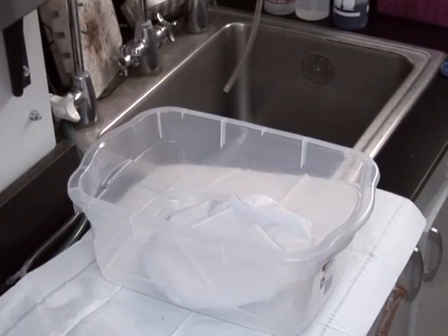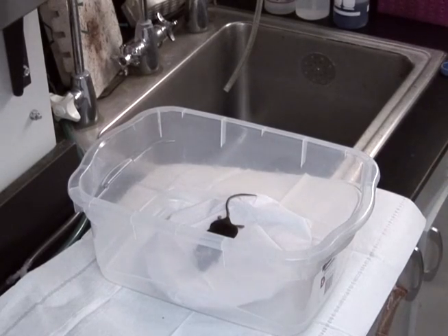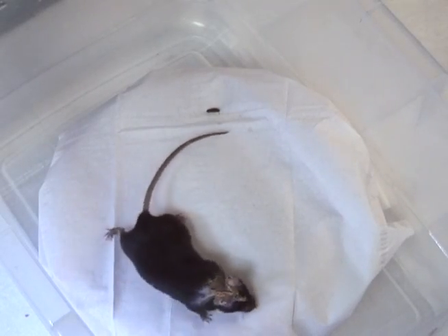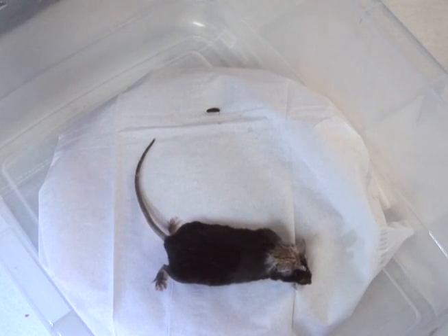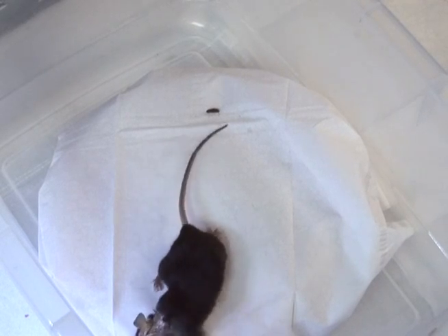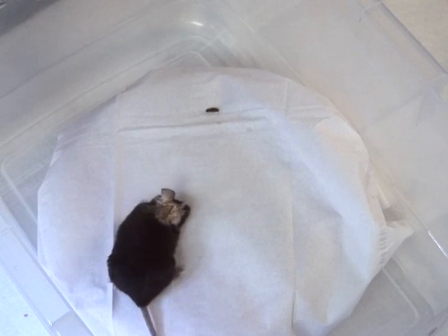After suturing the skin closed and applying antibiotic ointment, place the mouse on a heated recovery pad. Depending on the oligo concentration, it may take 20 minutes to a couple of hours to fully recover. Again, monitor the mice daily after the surgery to check for pain or discomfort and infections, and administer analgesics as needed.